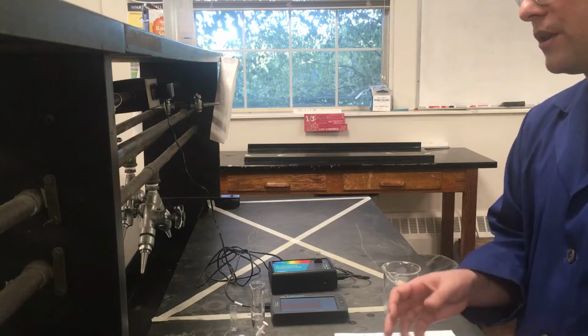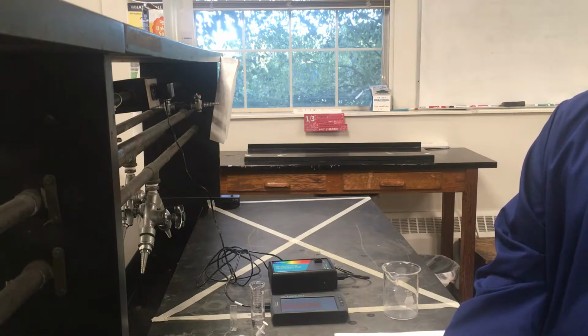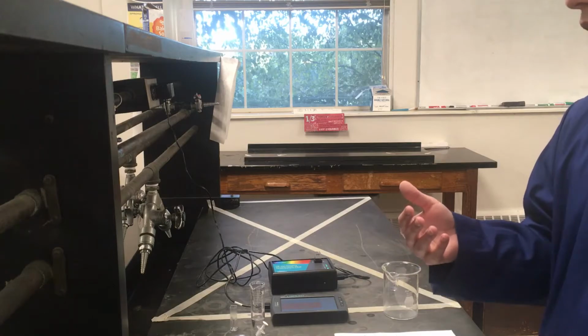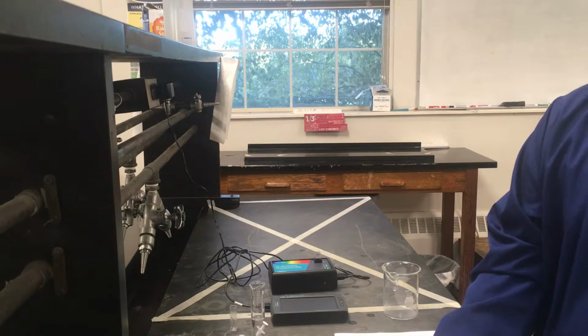To do that, the lab tells us we're going to take 5 milliliters of our crystal violet solution, and then we want to end up with a solution that's 20 milliliters in order to get the concentration we want. But that 20 milliliters does already include the 5 milliliters of our stock solution that we start with.